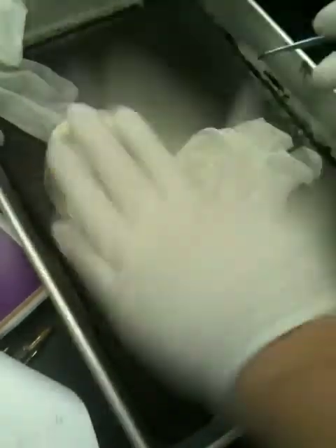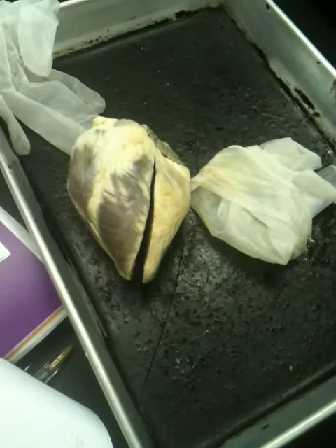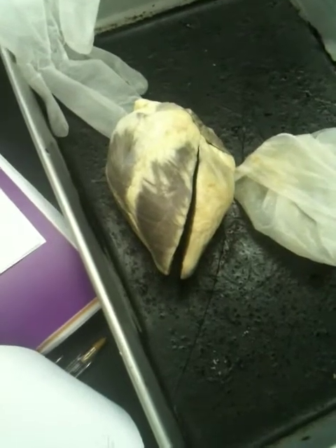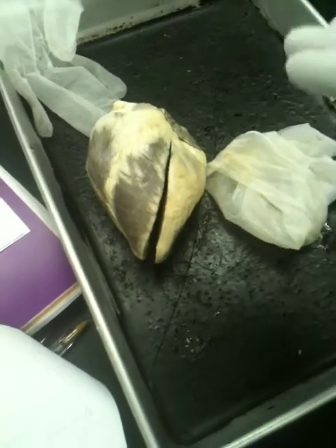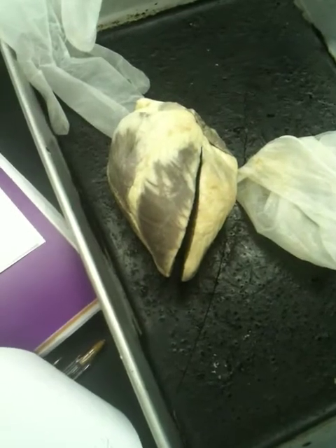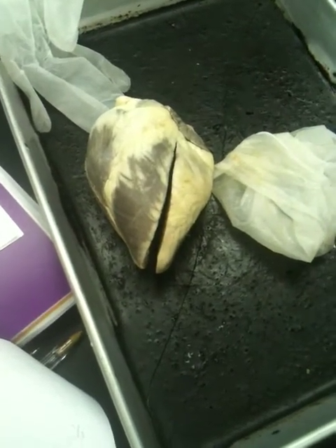The tricuspid's for three on the right side as well, right? So three, tricuspid. You can call it the right atrioventricular valve if you want to. There's only two names for that valve: tricuspid or right atrioventricular valve. It's immediately superior to the right ventricle. So what you do is eyeball the right ventricle. You know that because it's got a thin wall. The valve is a no-brainer. Just have to remember which is which.